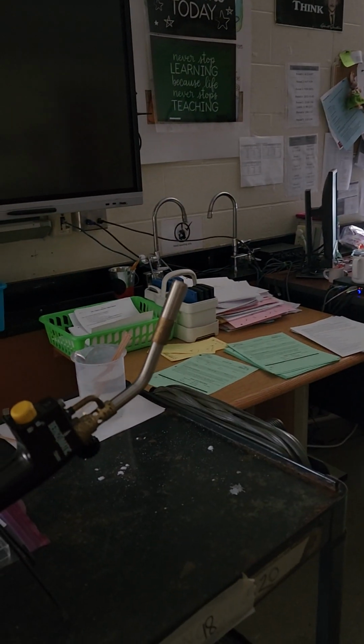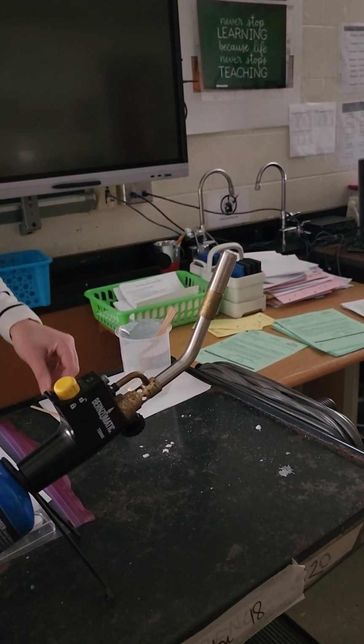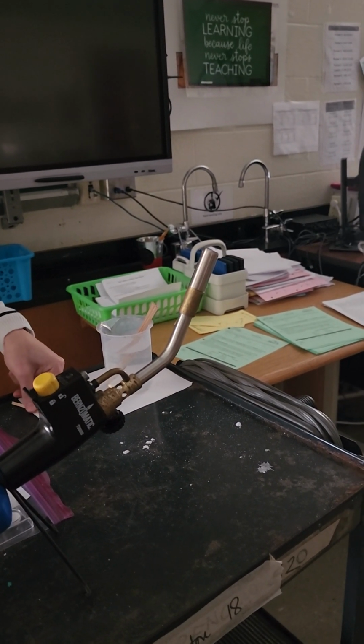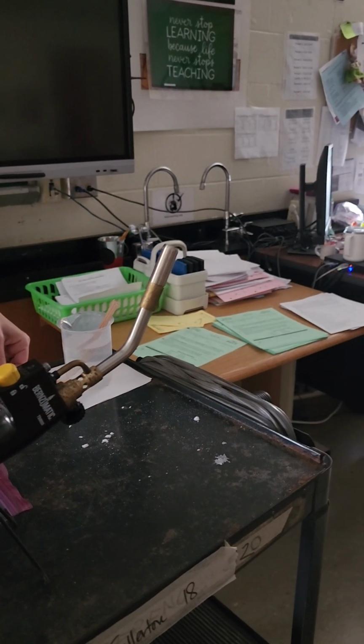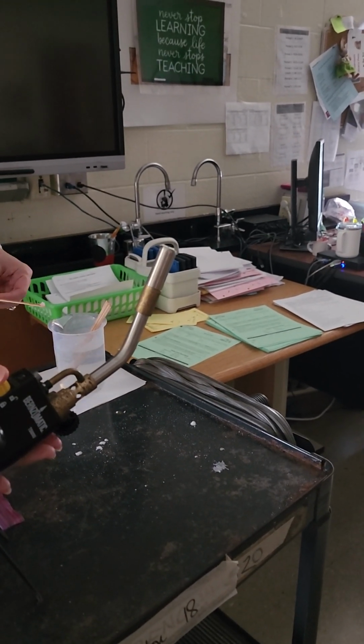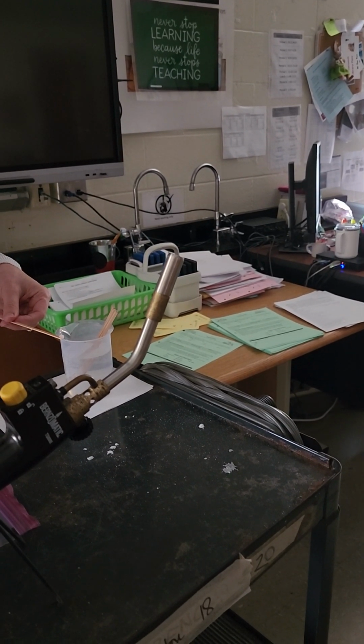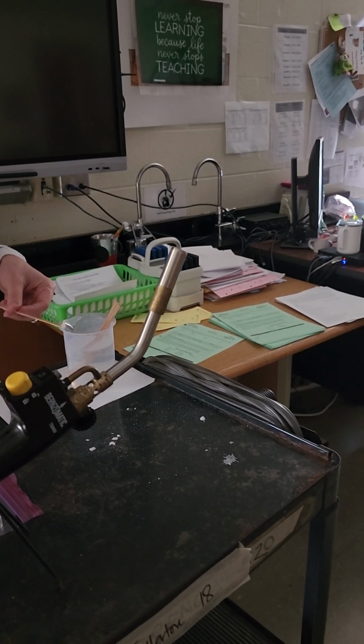So based on its flame color, go back and rewatch the video and see if you can identify what known flame color it matches from the front. Remember, this is a very unique color, okay? Very unique color that identifies it, because it's a characteristic property telling us which one it is. It identifies it like your fingerprint.